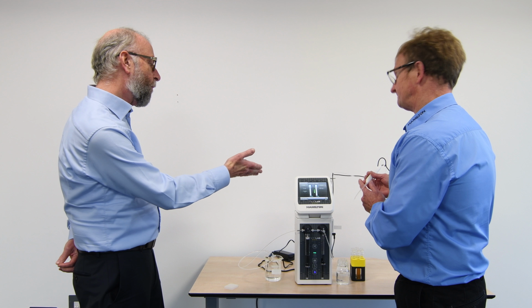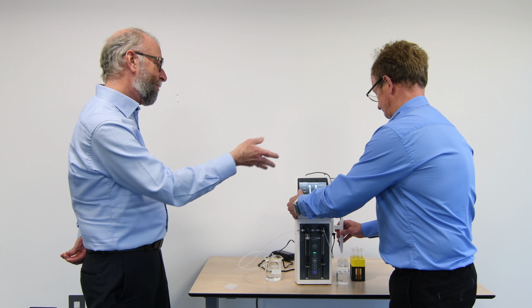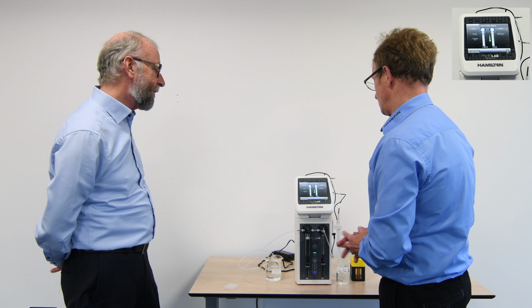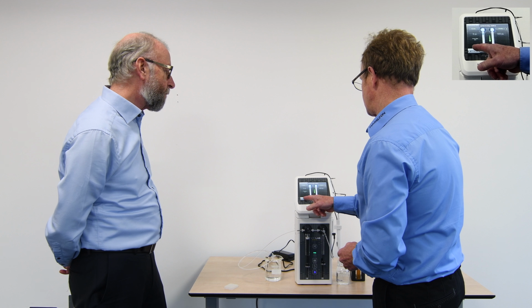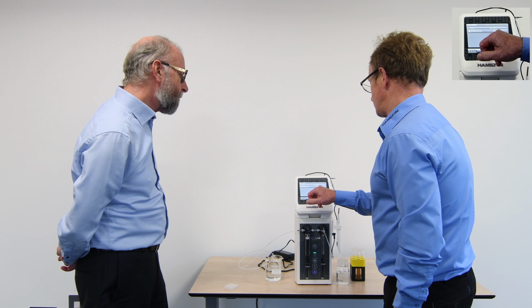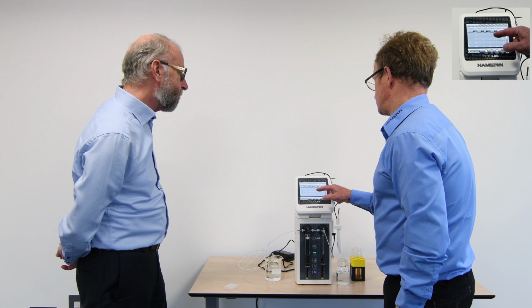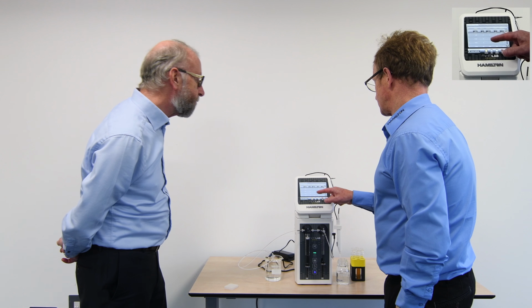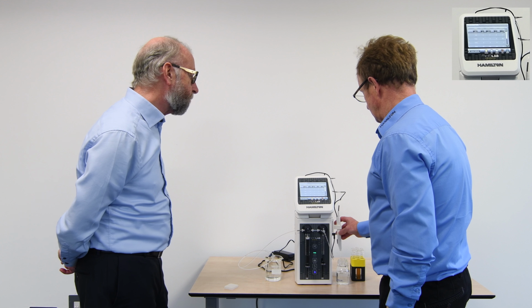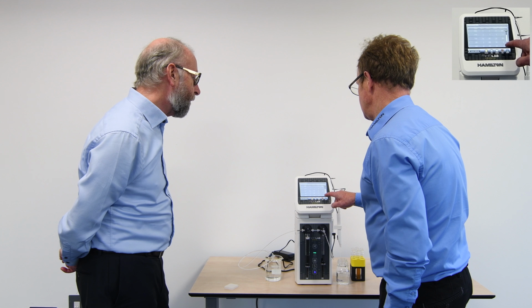Okay, and if I now wanted to edit that, so I felt happier with having a larger wash volume, can you show me how to do that, please? Yeah, sure. So if we go back into our custom methods, and now we highlight that particular method here, we have an edit function, and we can go to that. And we're able to go through each of the stages. So in your step, if you wanted to change that diluent volume to a higher ratio dilution, we can go to that step, which was at the end here. So just scroll through.